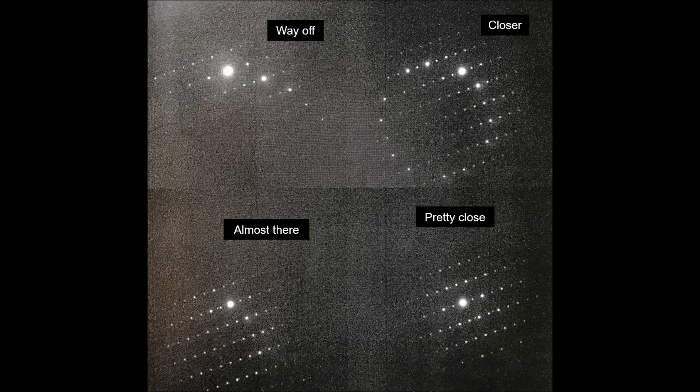And so if I tilt and get a little bit closer still, we can see that that circle starts to go away, like we see in the lower left. And then if I get closer still, we start to see on the lower right that we're actually starting to get close to satisfying that criterion of every spot and its opposite having the same intensity.